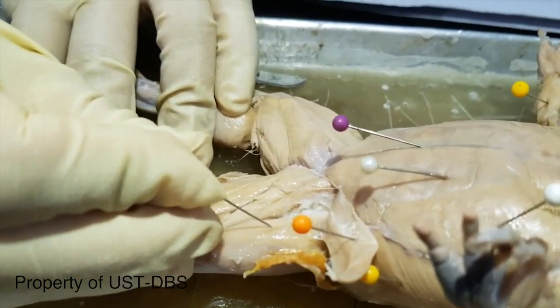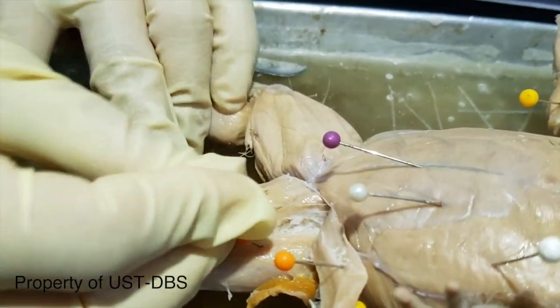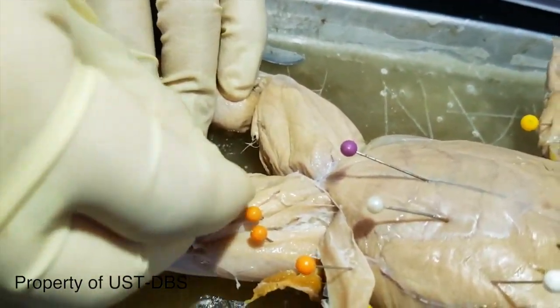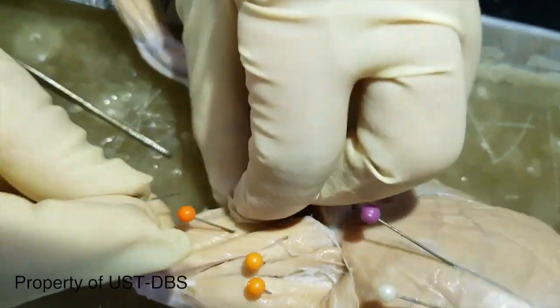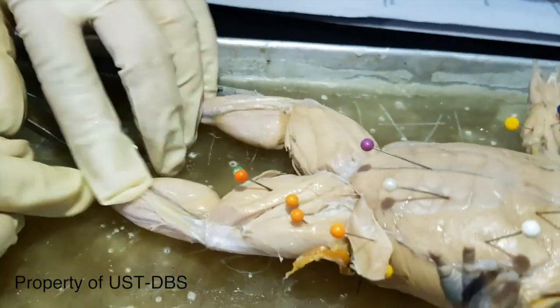So that's the adductor longus, adductor magnus, semimembranosus, and then the gracilis. Okay, muscles of the shank.